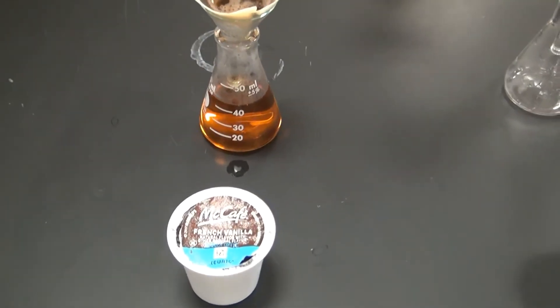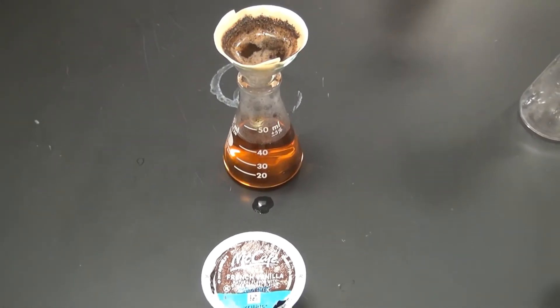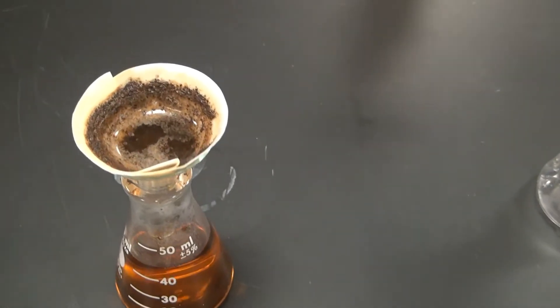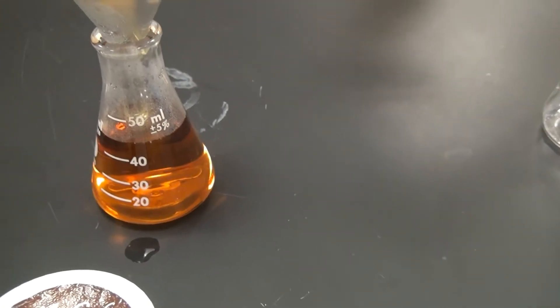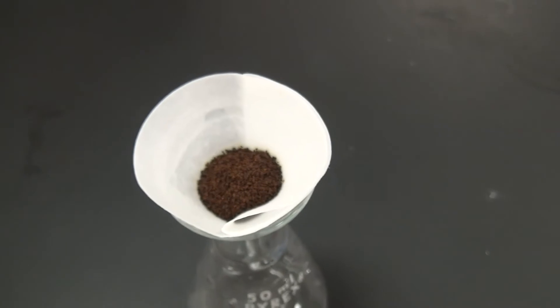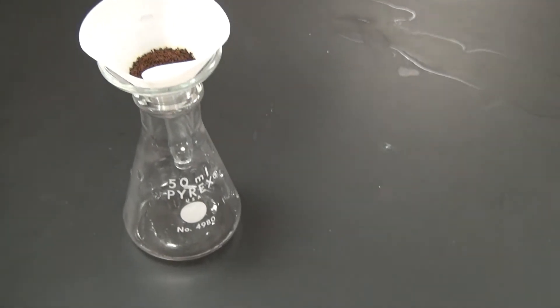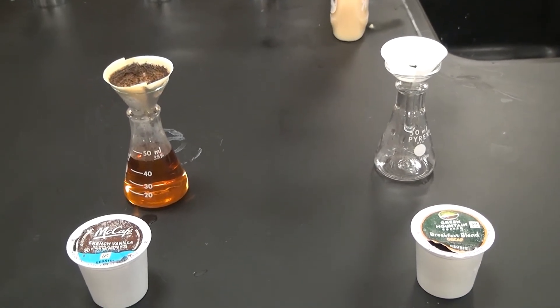Here is the setup used to prepare the coffee samples. The one on the left is the McCafe — I used a Keurig cup, cut it open, weighed out 1.013 grams, placed it in the filter, and poured 50 milliliters of hot water through it. The second coffee sample is the Green Mountain Breakfast Blend decaf with 1.002 grams in the filter. I'll be pouring 50.0 milliliters from a graduated cylinder of hot water through it shortly, and then we'll have our coffee samples to be analyzed.